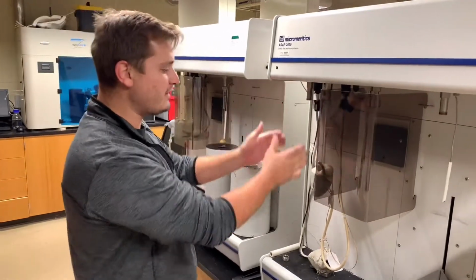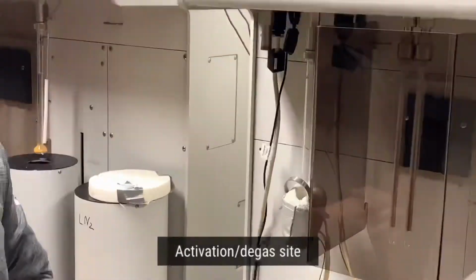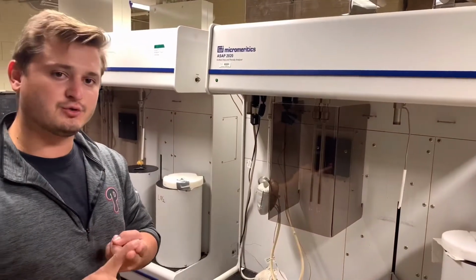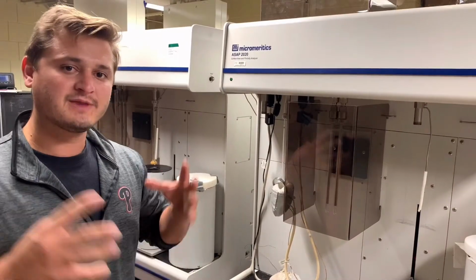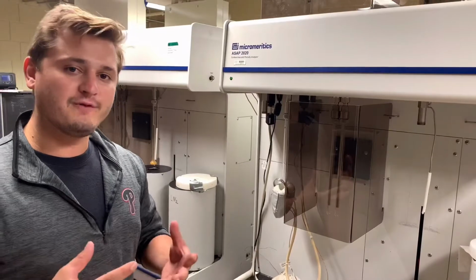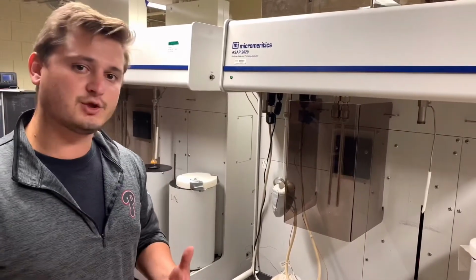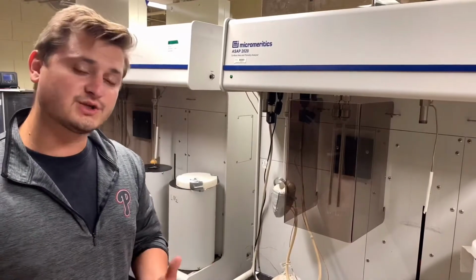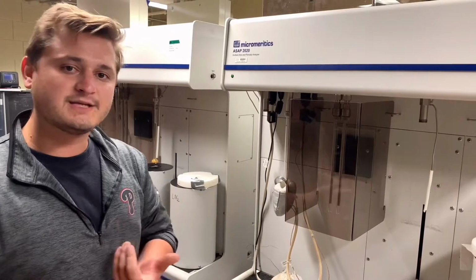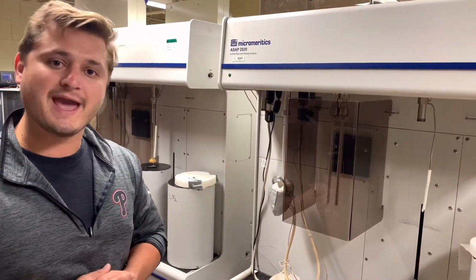So over here on the left, we have our two activation or degas ports. When we are talking about doing gas adsorption analysis, the two terms that are used are degas and activation, and they are synonymous with one another. What that means is we are removing all of the gas molecules and solvent molecules, or guest molecules, from within the pores of our metal organic framework, covalent organic framework, porous polymer network, zeolite, porous silica, any sort of porous material that we may be analyzing.